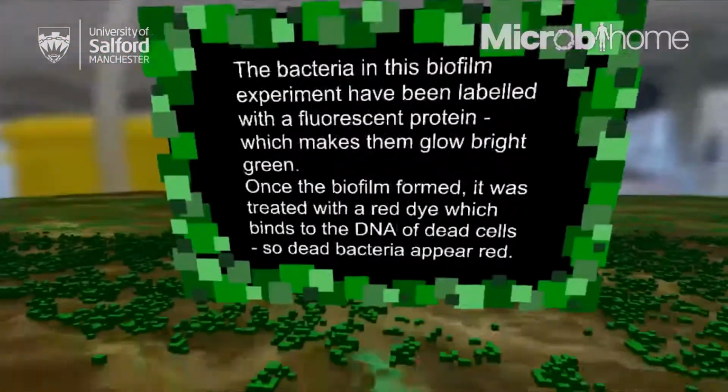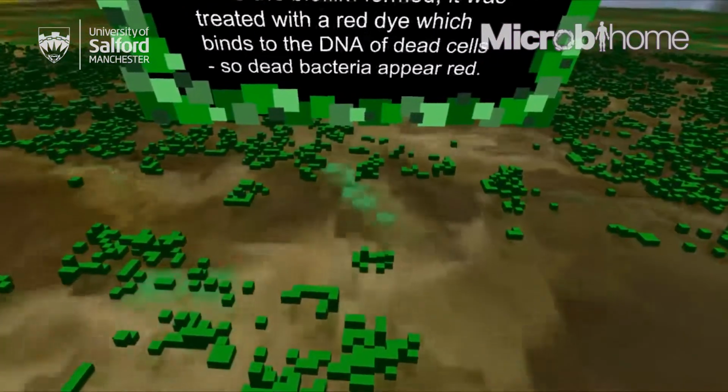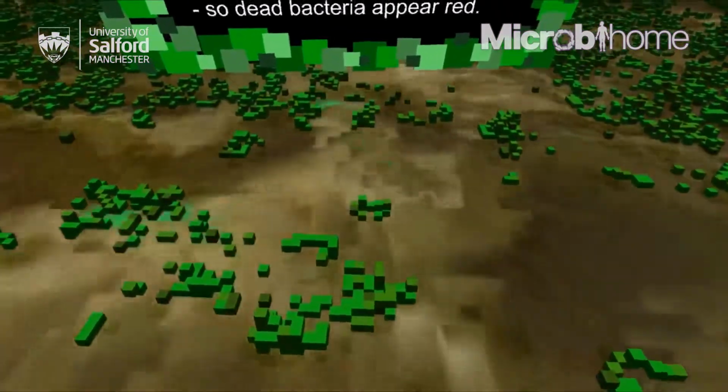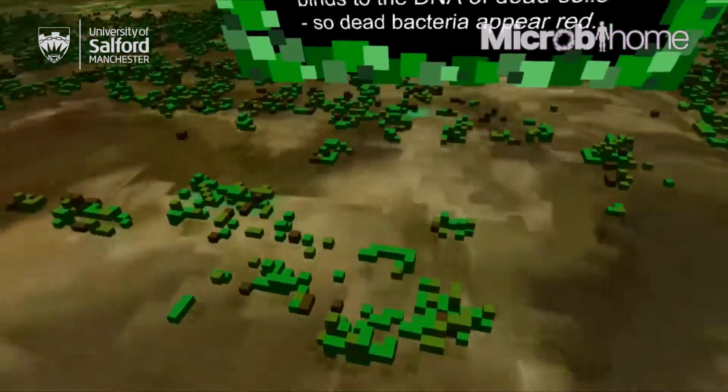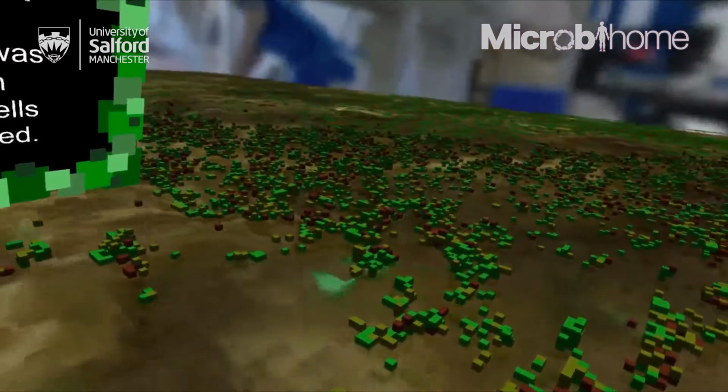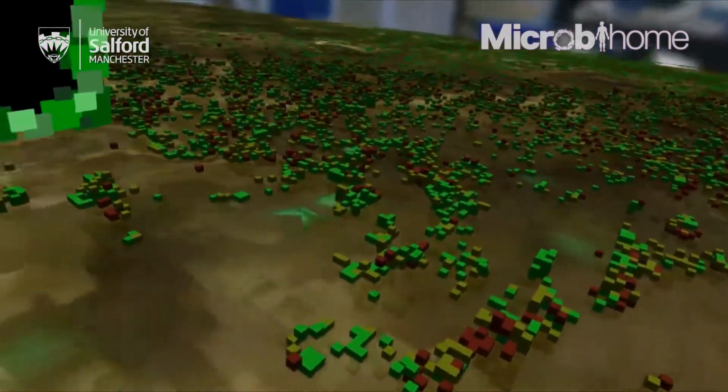The bacteria in this biofilm experiment have been labelled with fluorescent protein, which makes them glow bright green. Once the biofilm formed, it was treated with a red dye that binds to the DNA of dead cells, so dead bacteria can appear red.